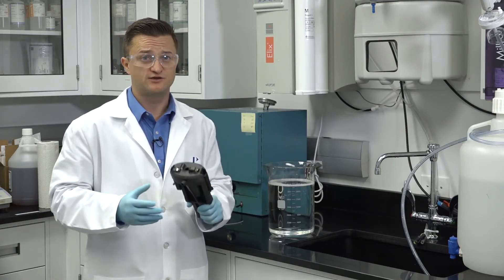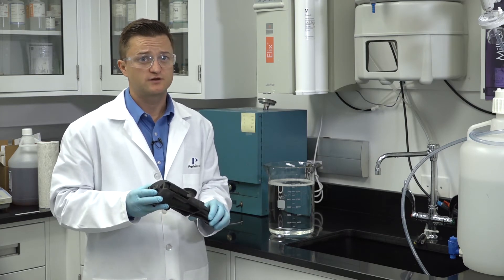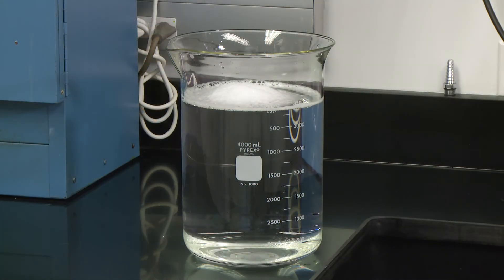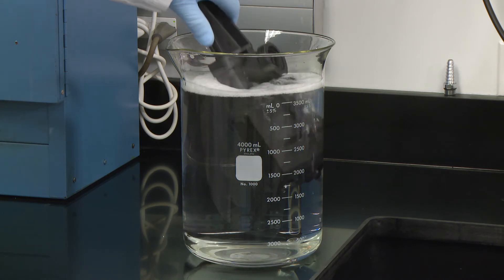Now that the nebulizer is removed, we can clean the chamber. To do this, place all the parts in a detergent solution and allow to soak for 10 to 30 minutes.